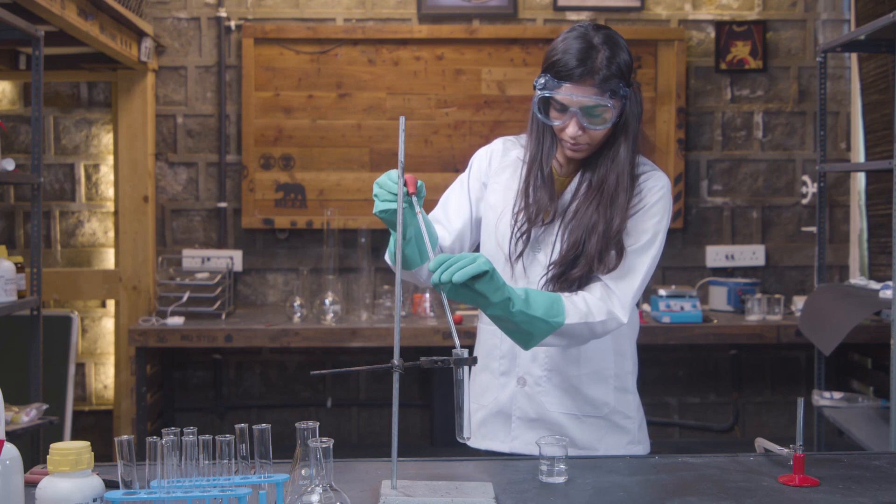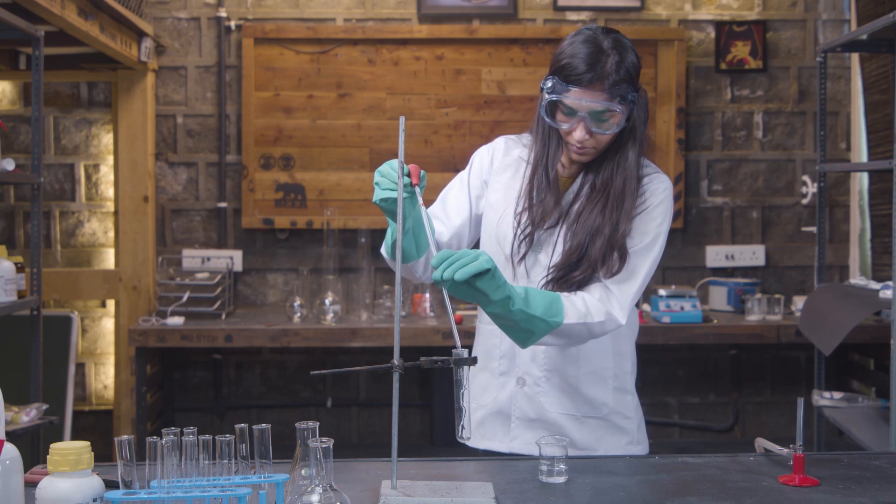Okay now, what is the point of burning if there isn't a pop to it? Time to grab the test tubes.